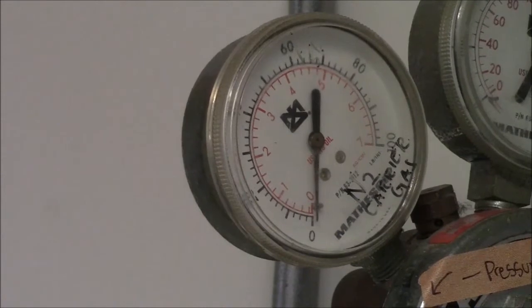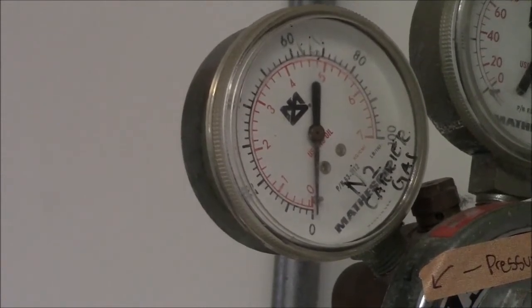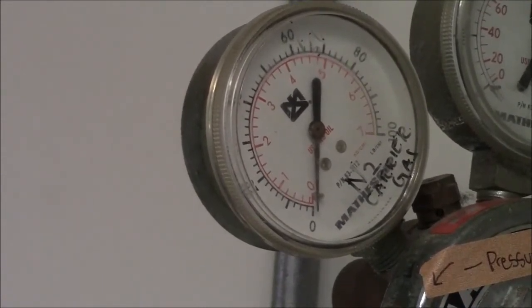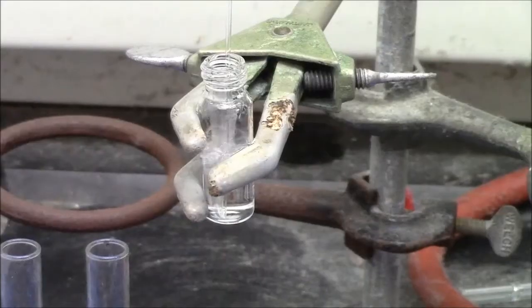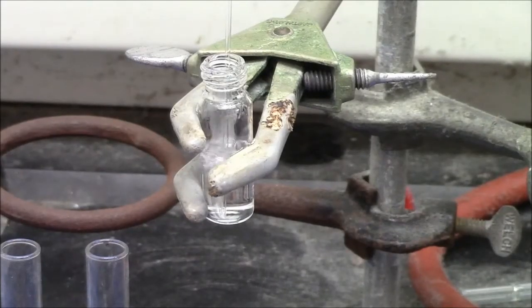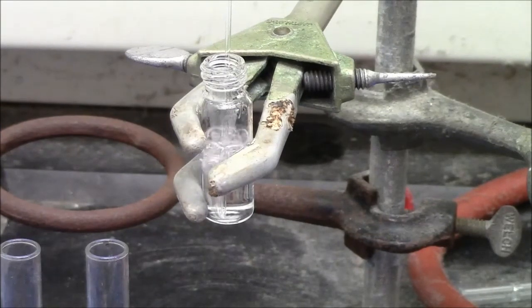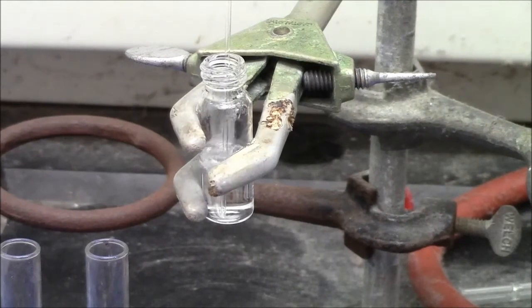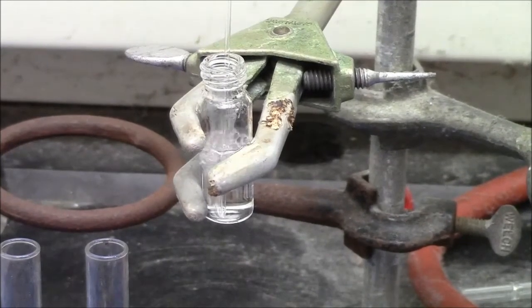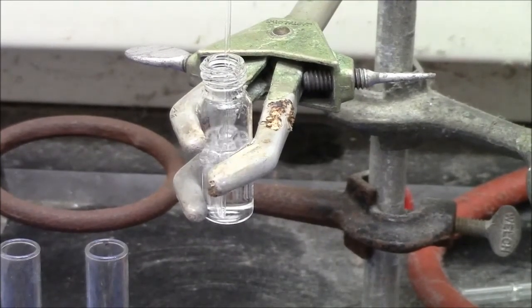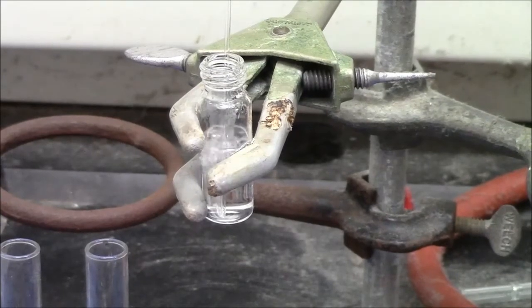This is the pressure gauge for the polymerization, very low pressure. At this point we have the buffer and all the monomers in there but not the SDS because that would cause a lot of foam and no APS yet because that is what will initiate polymerization. So those are made as separate solutions which will be added after this degassing is complete.